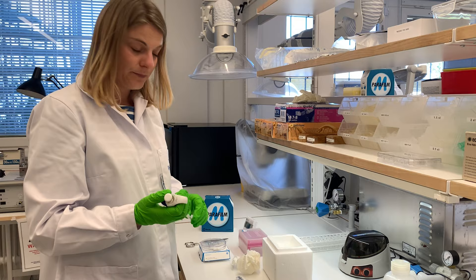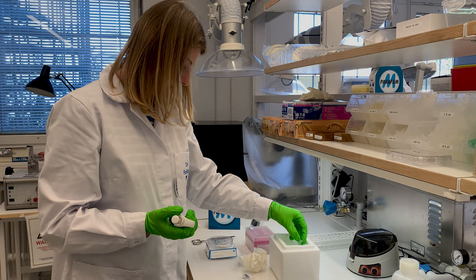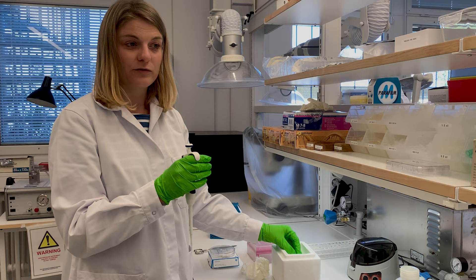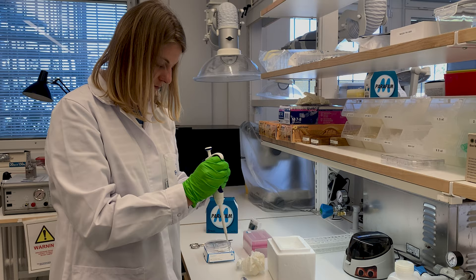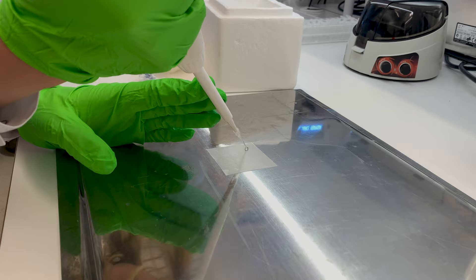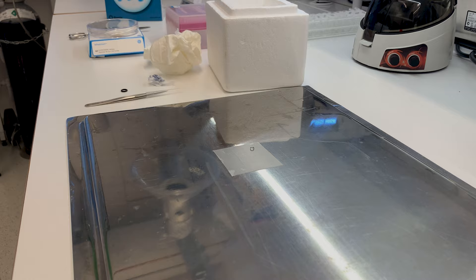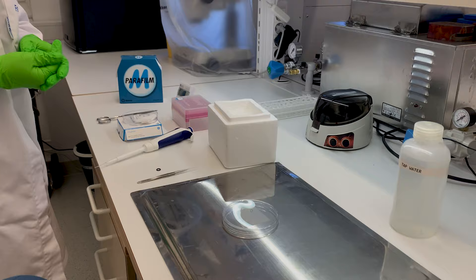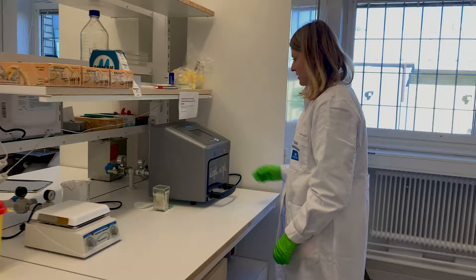We can already aliquot a droplet of our sample from the tube. Depending on your preference, the sample can warm up to room temperature now, or we can do it after we've taken care of the support grids if you prefer to keep it cold for as long as possible. I tend to use 20 microlitre droplets — you can use less if your sample is very precious. I'll just leave it here and cover it with a petri dish so there's no dust falling in.